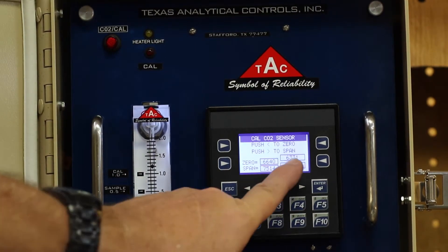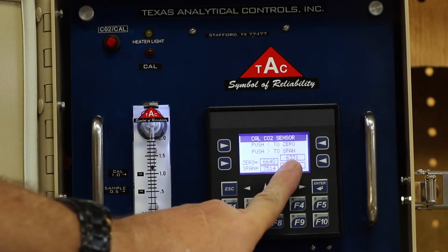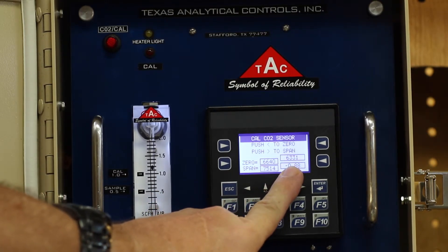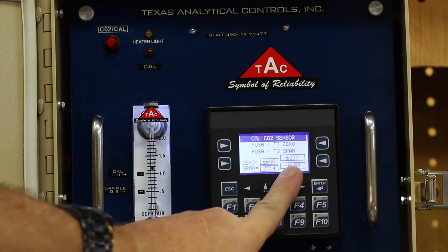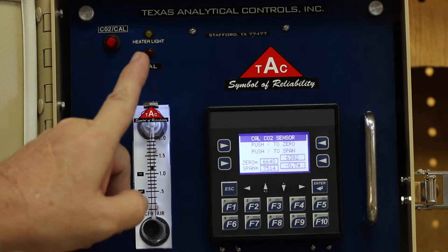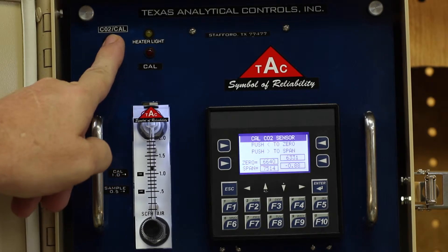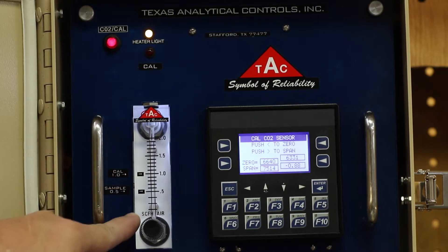The display will show the current counts and the CO2 reading in percent. Press the red button on the front plate to start the calibration. Note the flow meter will drop to zero.